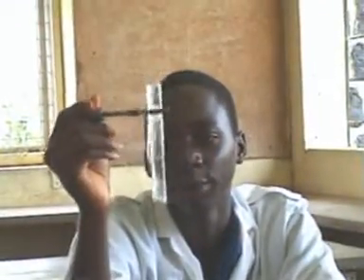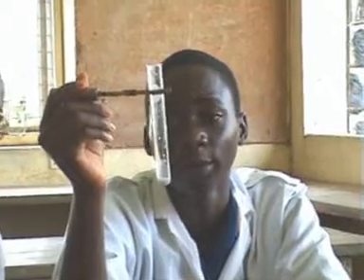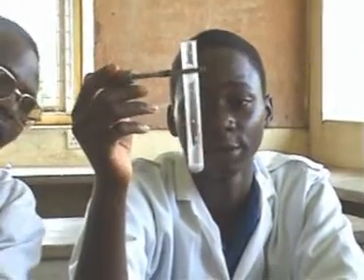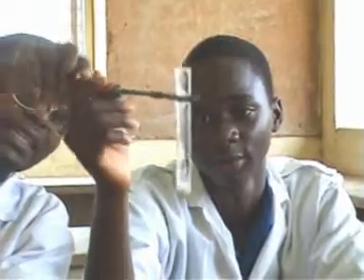Yes. So what have you observed? Tell us what you have observed. I've observed a blue-black coloration. So the white solution turned blue-black. But what is the intensity? When I look at it, I see that the intensity of the blue-black coloration is very, very mild. So this implies that this food substance contains very little starch.